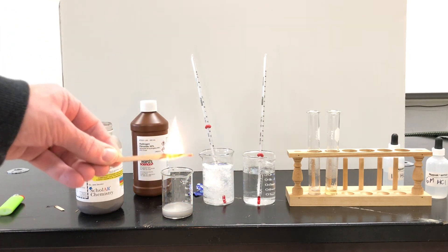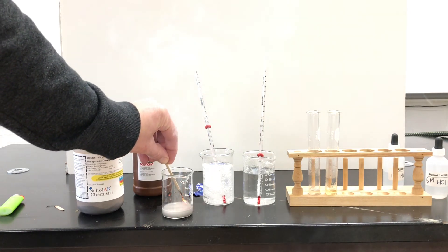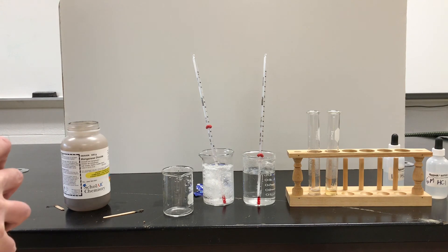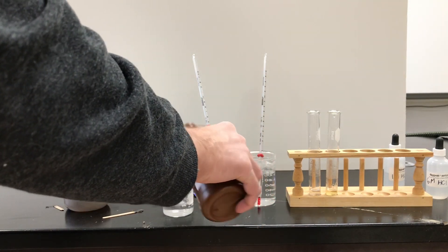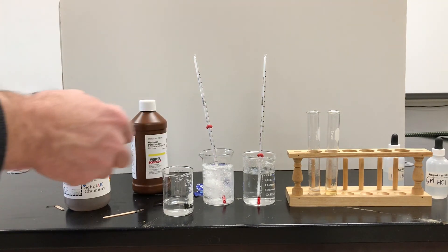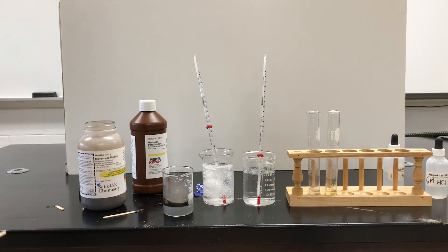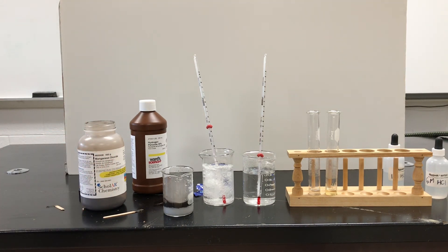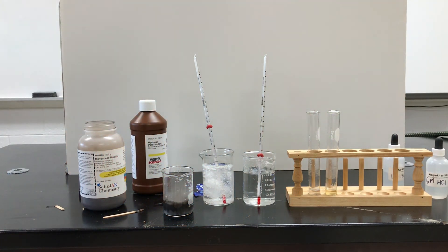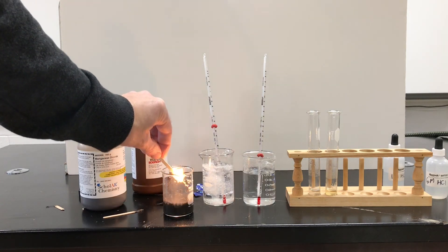Another dramatic experiment is to blow out this splint, have it glowing, and put it back into the beaker. I ran out of hydrogen peroxide, so we're going to try this again with fresh hydrogen peroxide and fresh manganese dioxide. Get that reaction going — there we go. That's a good amount of gas. Look at that oxygen gas coming off. If I have a glowing splint and put it in, it'll definitely catch back on fire again. There you go — that's what I was looking for beforehand.